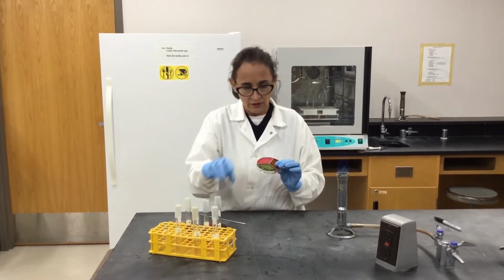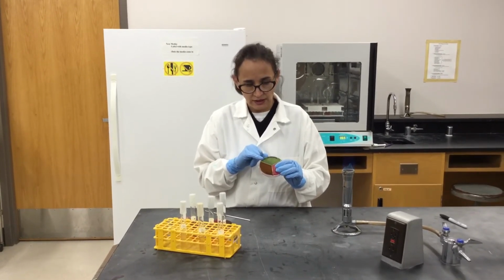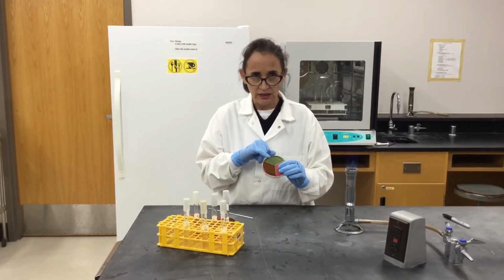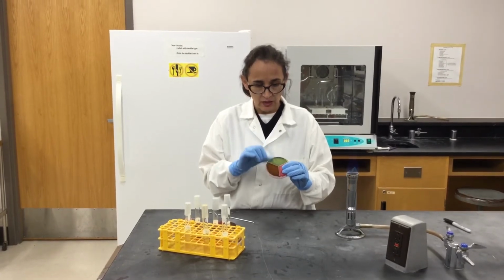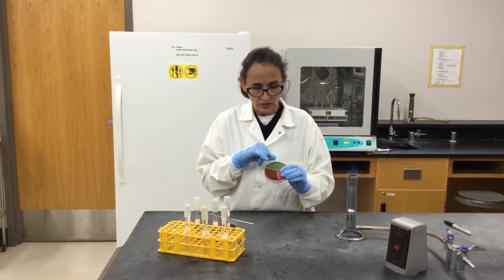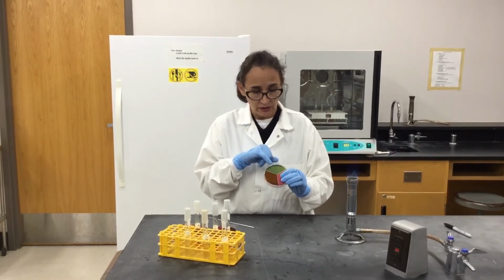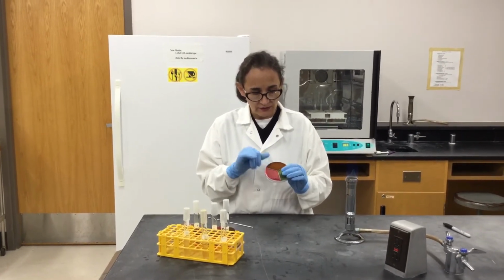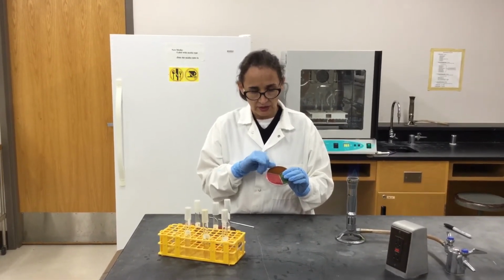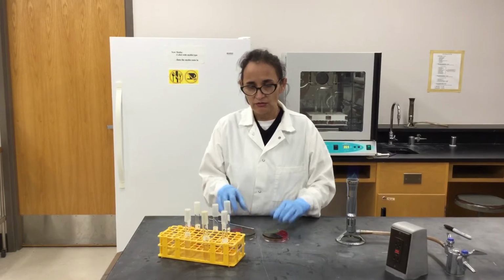yellow. And then for citrate agar, this media has citrate, which is a substrate, a carbon source of energy for some bacteria that have an enzyme that is called citrase. Now if the bacteria have the citrase enzyme, they're going to utilize citrate, and it's going to turn the color of the media from green to blue. And in the case of eosin methylene blue, this is a differential media for gram-negative bacteria, so only gram-negative will grow in here. So anyway, we have then 3 bacteria to grow.